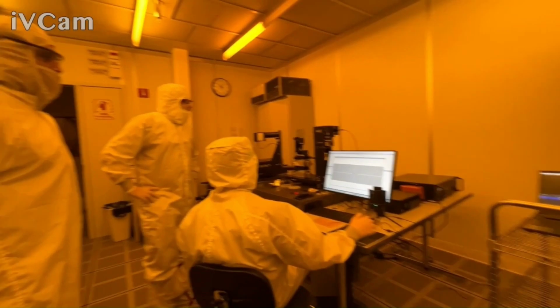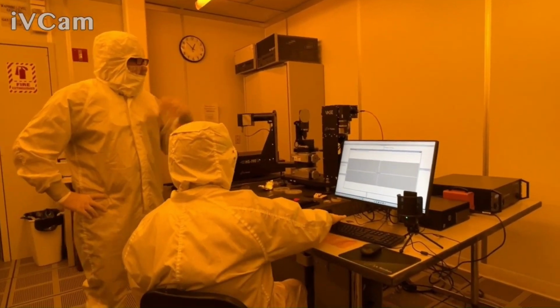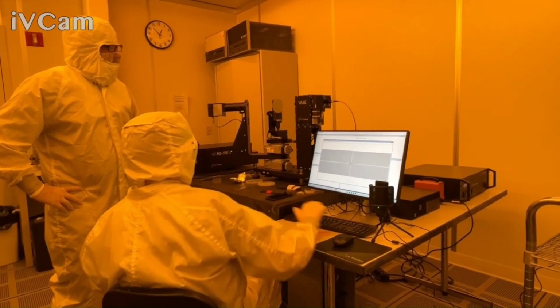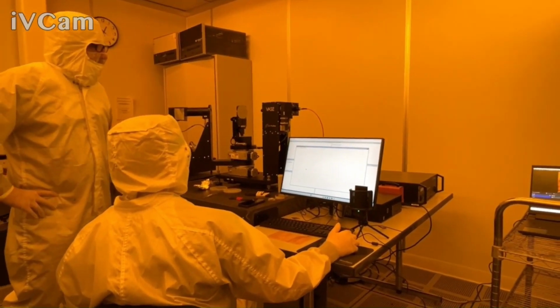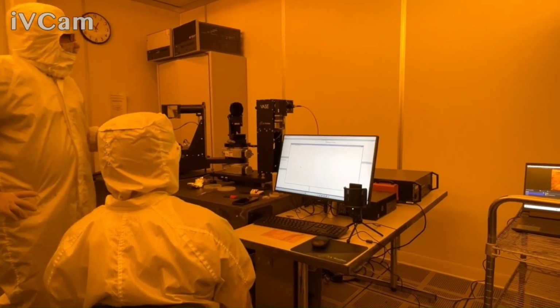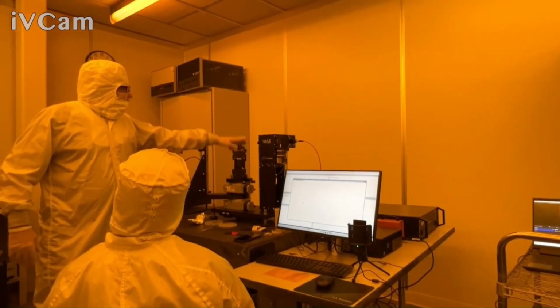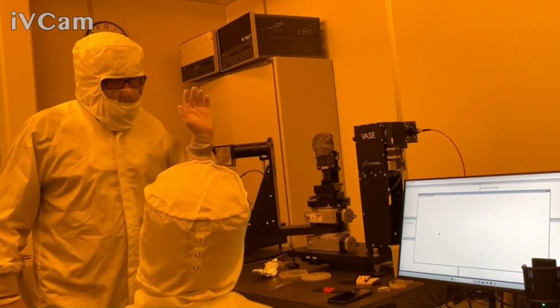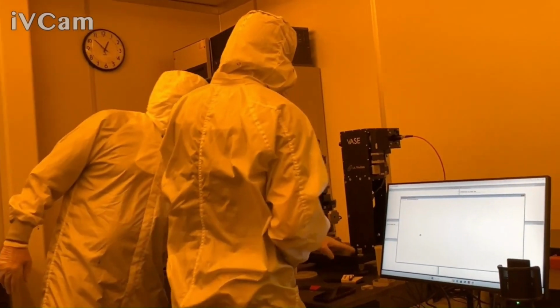So when you say escape now, it'll continue to the height alignment step. So I'll just hit escape. I wish it said continue instead of escape. Now this is where whether I leave this in or out really depends on what I'm going to do for my measurement. So again, for calibration, I take it out. Put it here.